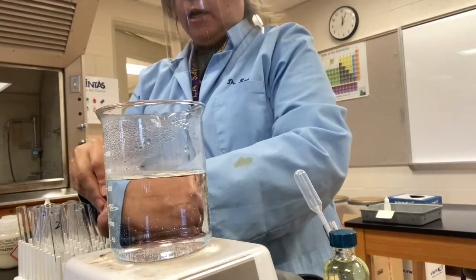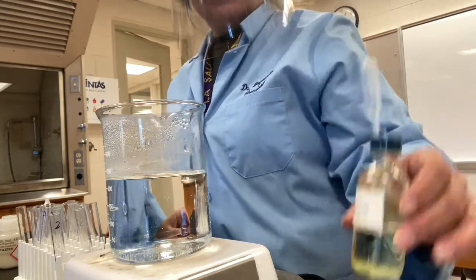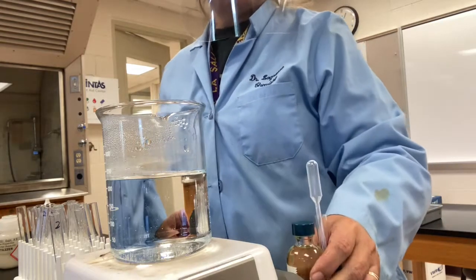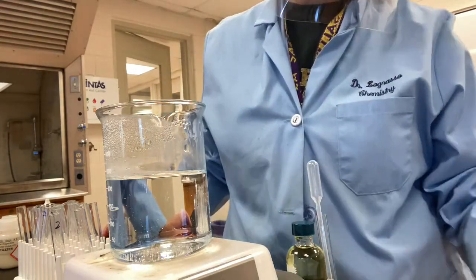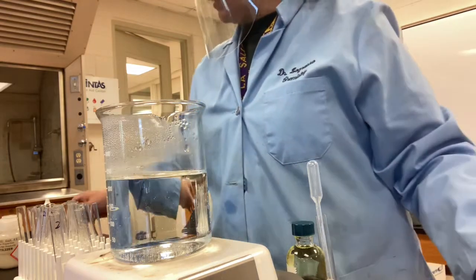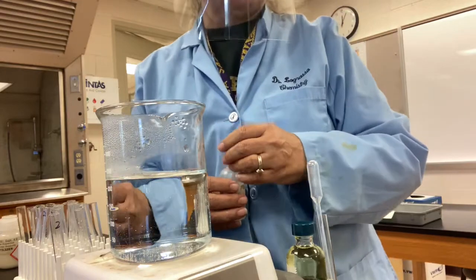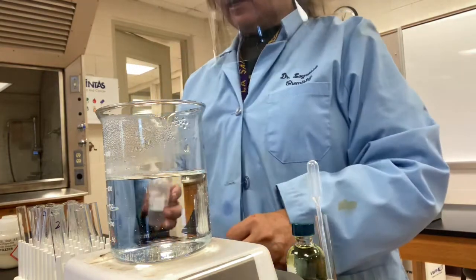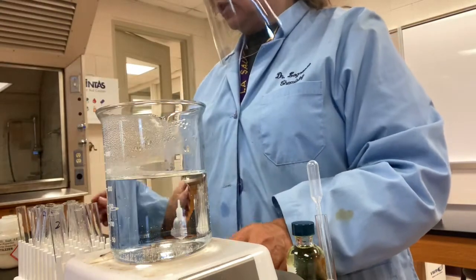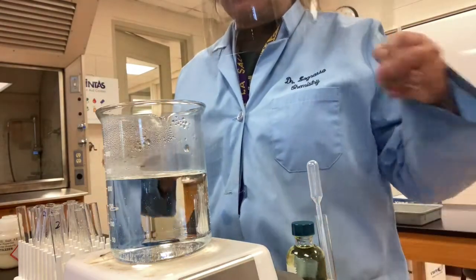Okay. Now, in order to activate the reagent that's going to test for phosphate, which is this molybdate reagent, I'm going to add some nitric acid. The nitric acid will activate and make the molybdate substance react properly with the phosphates. So I have to add the nitric acid into the test tubes until they test acidic using litmus paper.